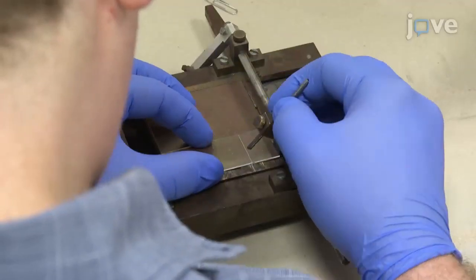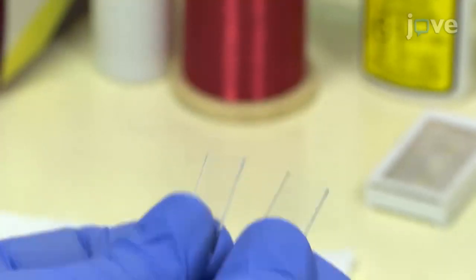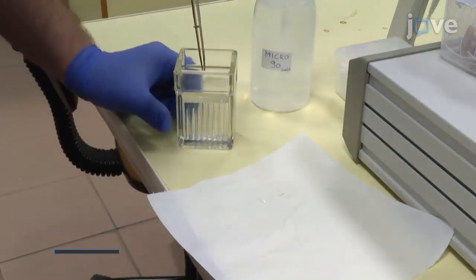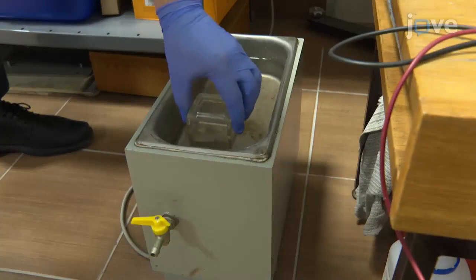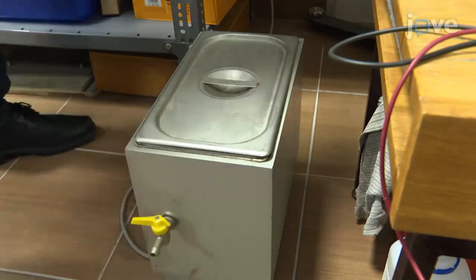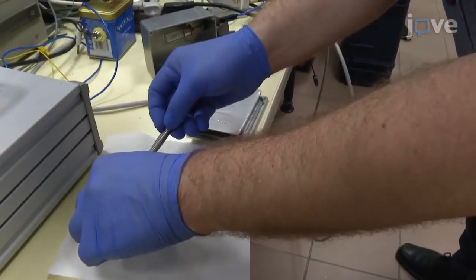Before beginning the procedure, use a diamond-based glass cutter to cut glass substrates with average sizes of 1 by 1 cm and wash the pieces at 38 or 42 kHz in an alkaline detergent. Next, rinse the substrates with 10 5-minute washes with sonication in fresh distilled water per wash and subject the substrates to UV ozone for at least 10 minutes.